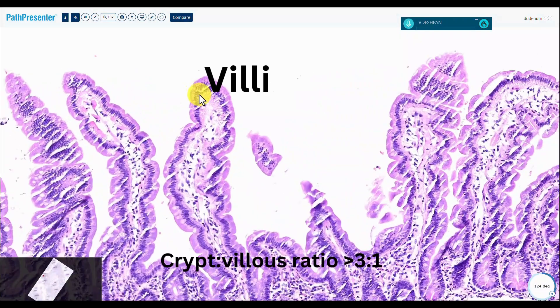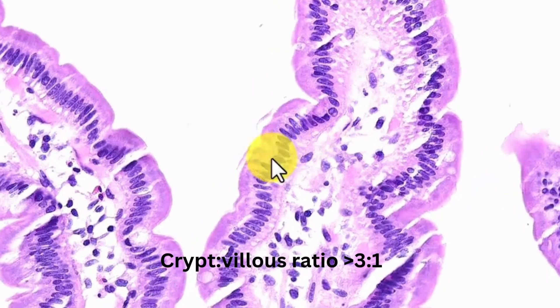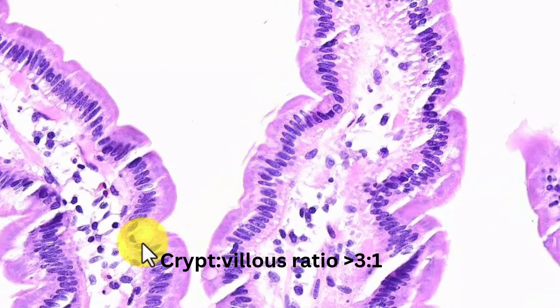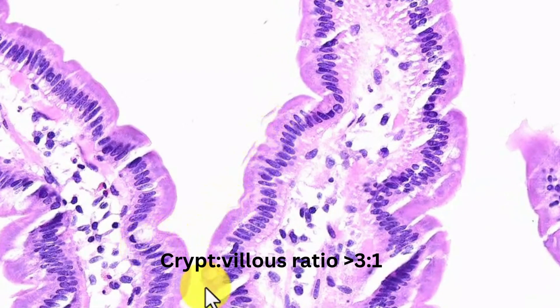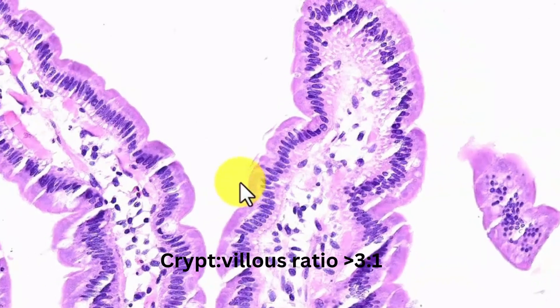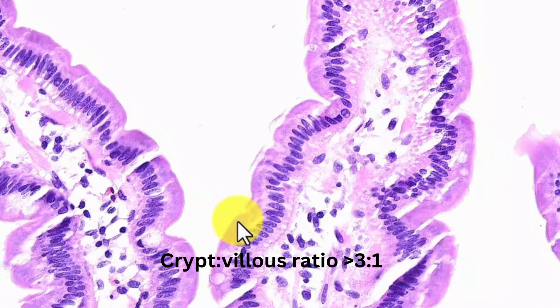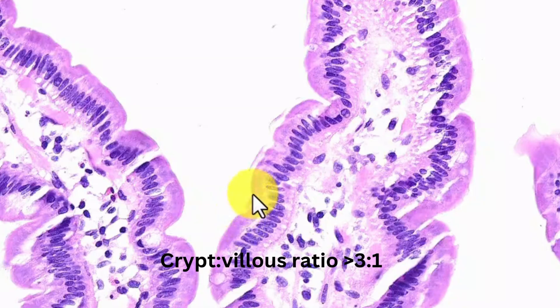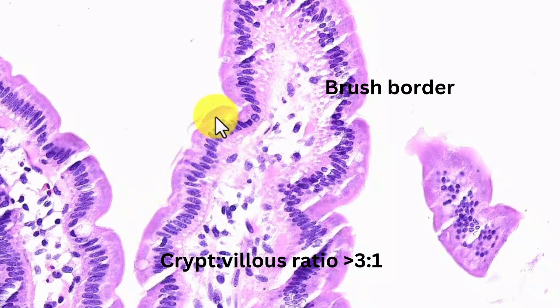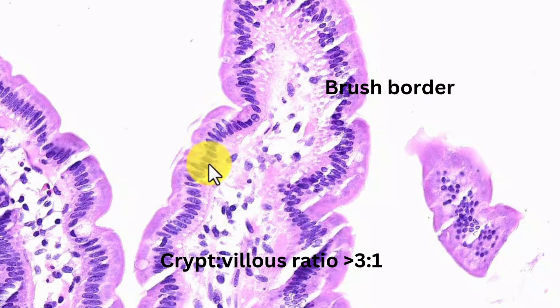If you look at the epithelial cells themselves, you'll see two types: absorptive cells and goblet cells — and here are the goblet cells. The absorptive cells, when you go really high magnification, will have a brush border, an apical cup of cytoplasm, and basal nuclei.